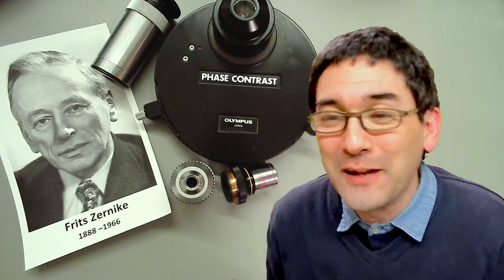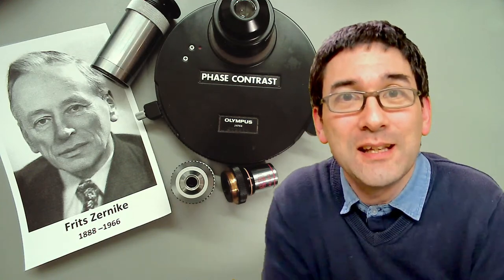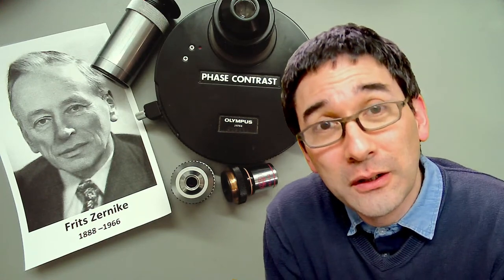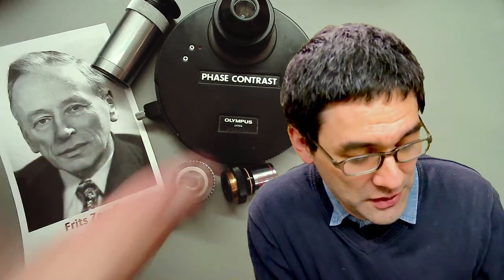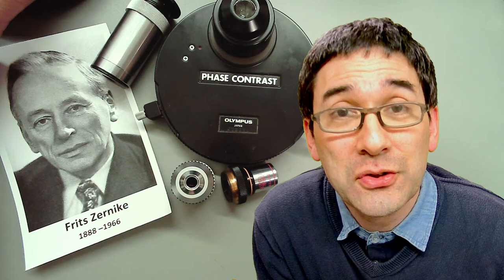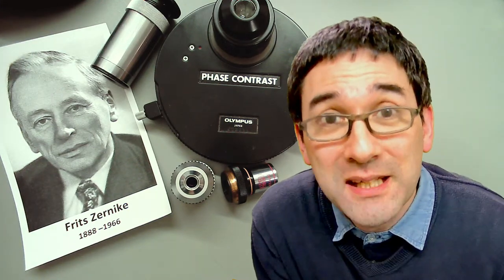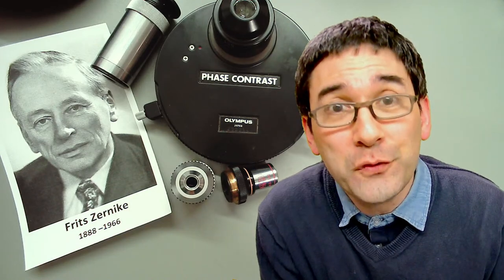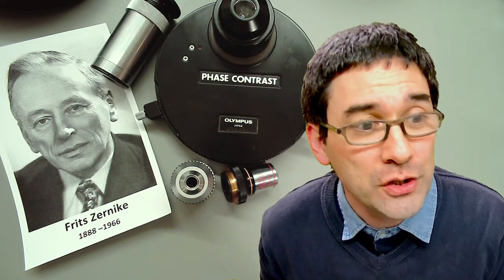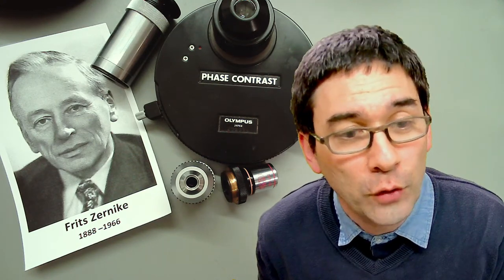Today I'd like to talk about phase contrast microscopy. First a little theory, then my personal experiences, and then I'll put several specimens under the microscope. For those who don't know what phase contrast microscopy is, I'll give a quick demonstration. I'm switching over to the microscope view — I'm currently using a 40x phase contrast objective.